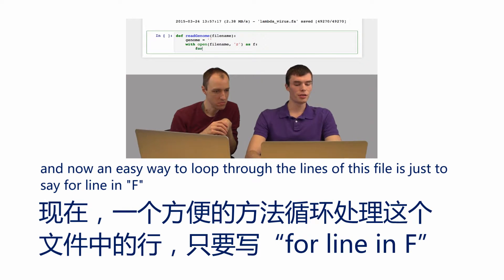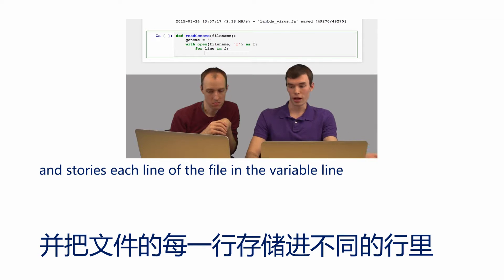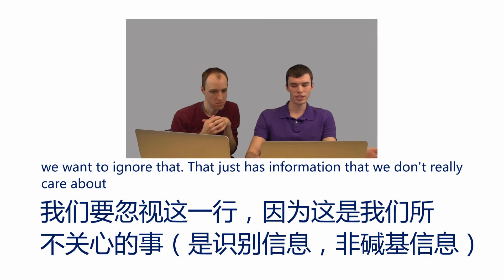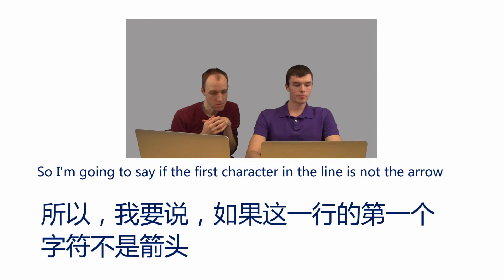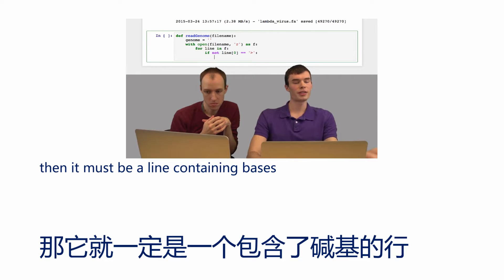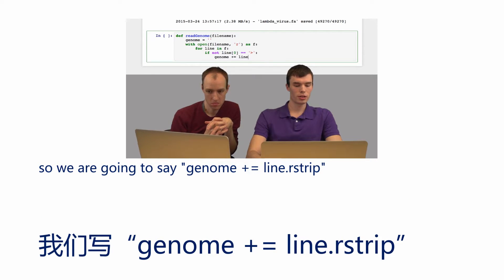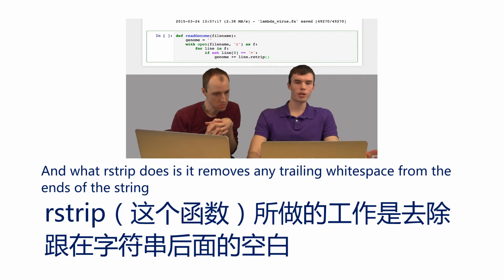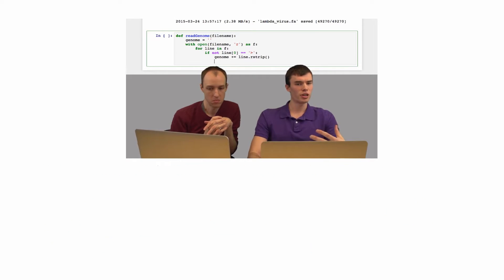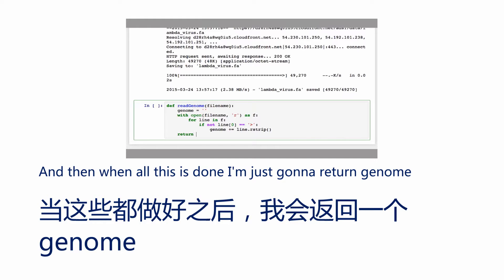An easy way to loop through the lines of this file is to say for line in F — it will read the file line by line and store each line in the variable 'line'. The first thing I need to do is check if it's the first line of the file, which starts with an arrow — we want to ignore that, as it just has identifying information we don't care about. If the first character in the line is not the arrow, it must be a line containing bases, so I'll add it onto our genome string using genome += line.rstrip(). The rstrip() method removes any trailing whitespace from the end of the string, including the newline character, spaces, tabs, or any other whitespace. When all this is done, I return genome.